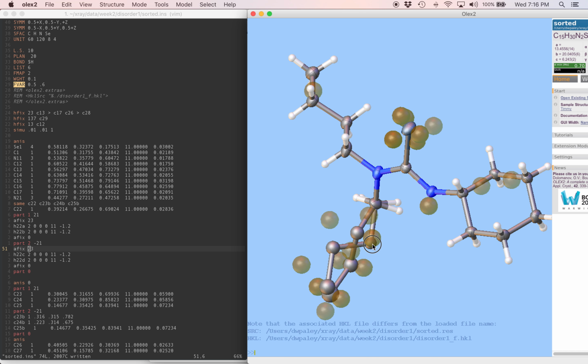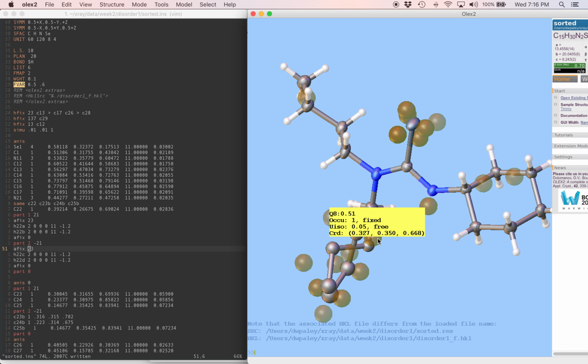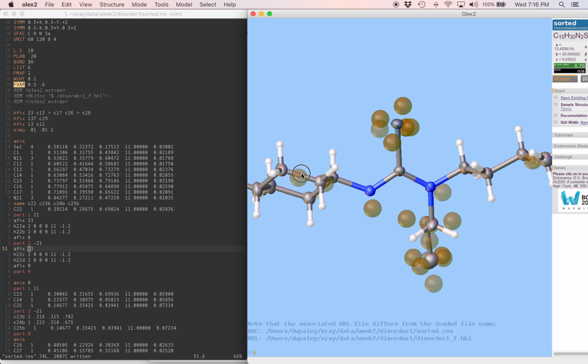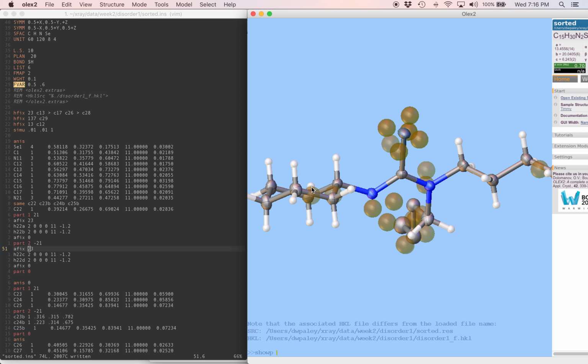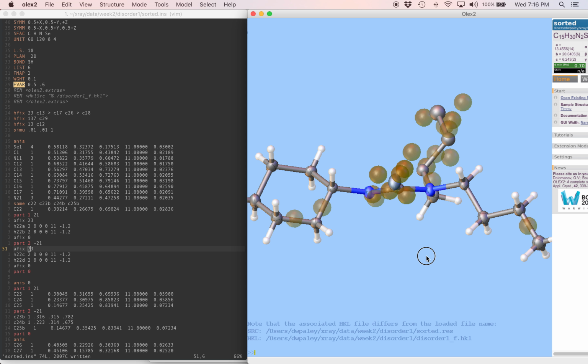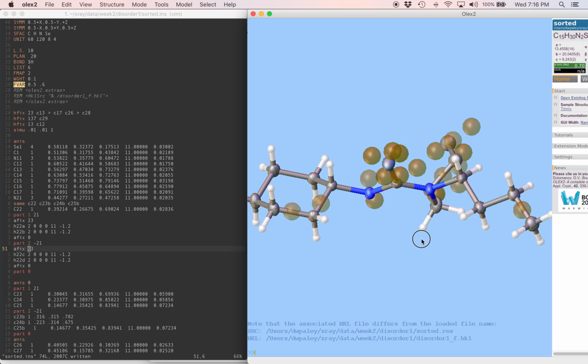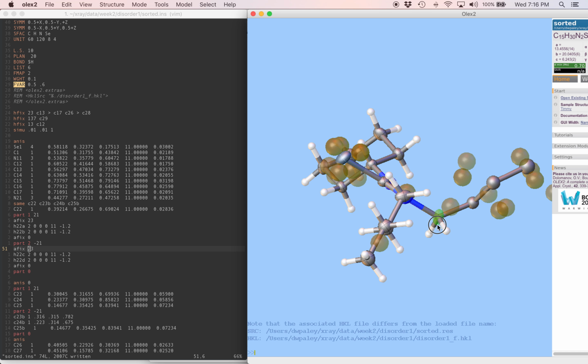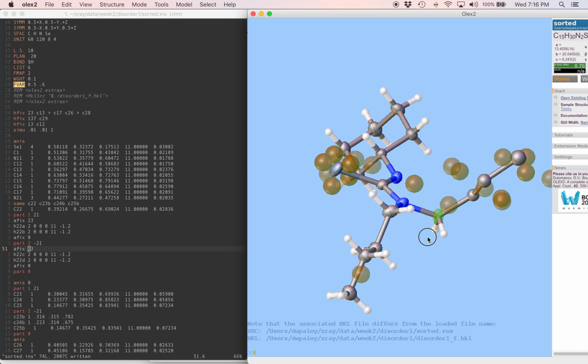What are we doing now? We can look at parts 0 and 1. Those hydrogens look like they're in the right place. And parts 0 and 2. This also looks right. This carbon looks tetrahedral when you view these four atoms attached. So it looks like we did good here.